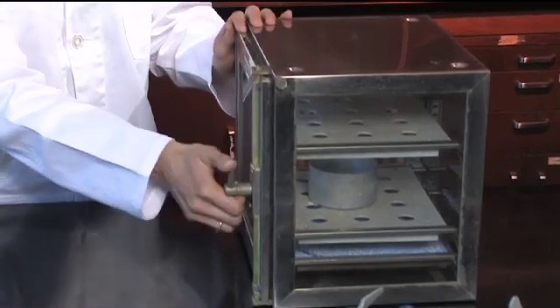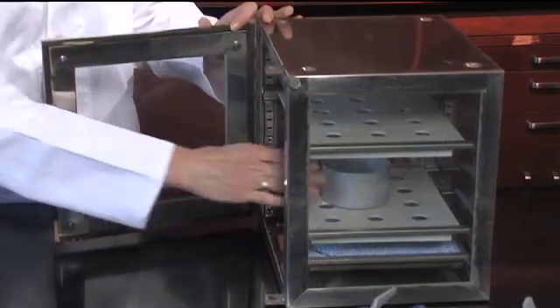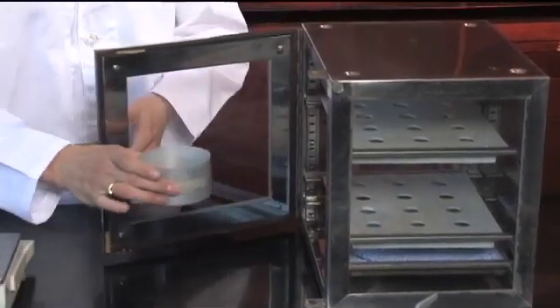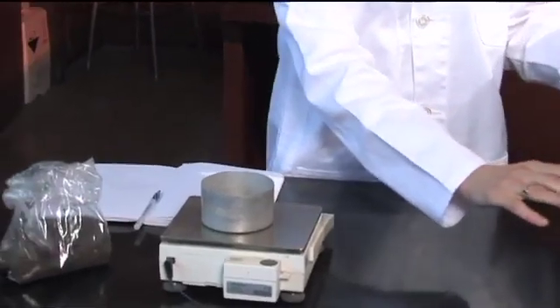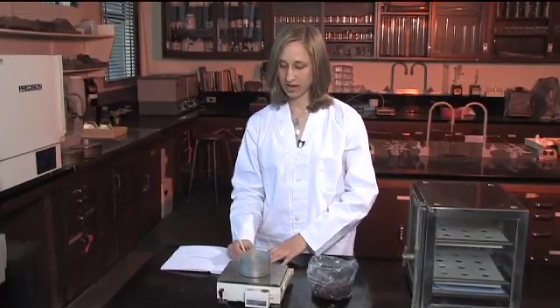I have a sample in here that has already been weighed and dried. We'll take it out of the desiccator and record the weight of the dry tin.